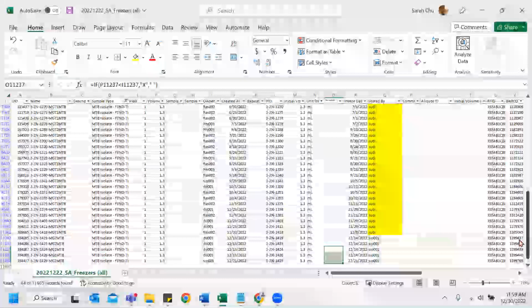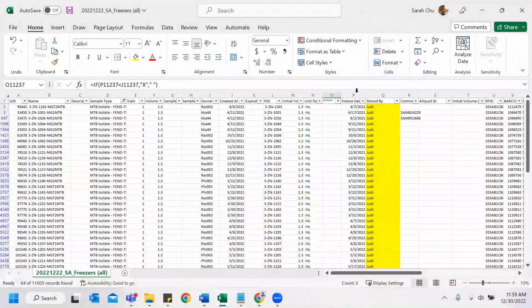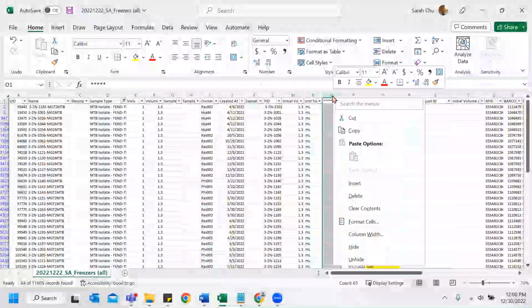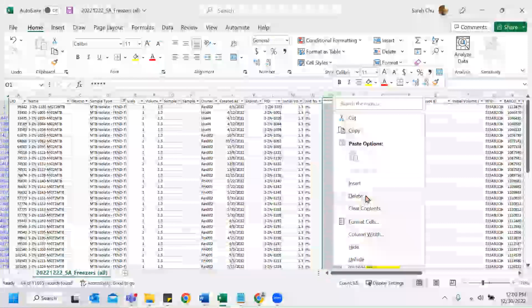And then I check again to see, is there anything wrong? No X's. Okay, we're perfect. In this case, we're just going to delete.